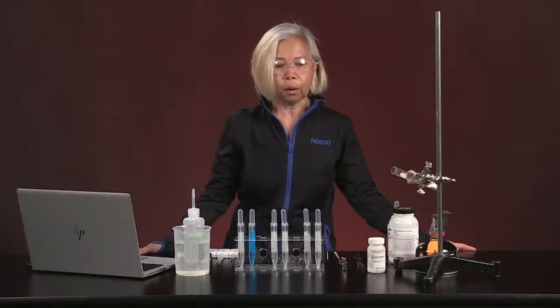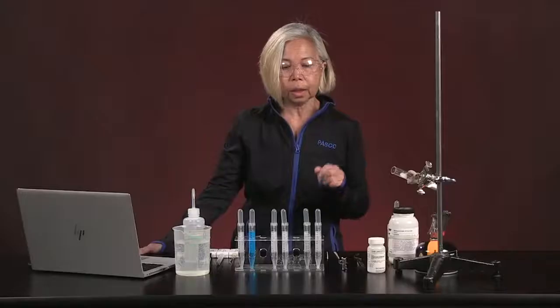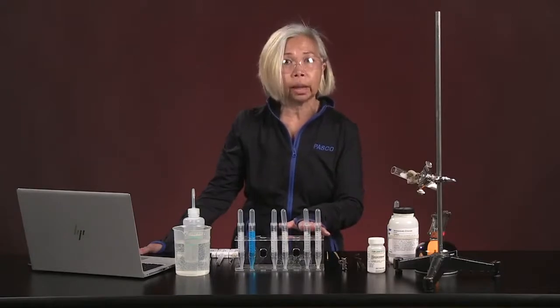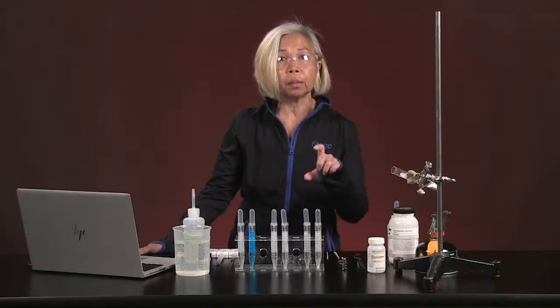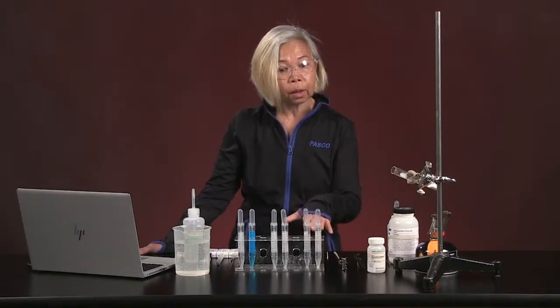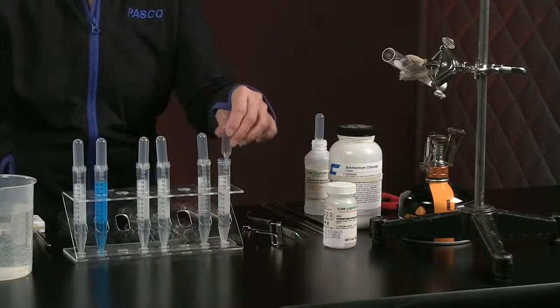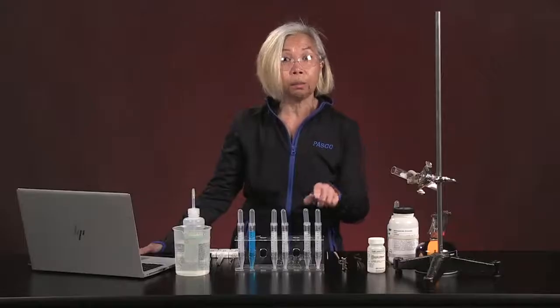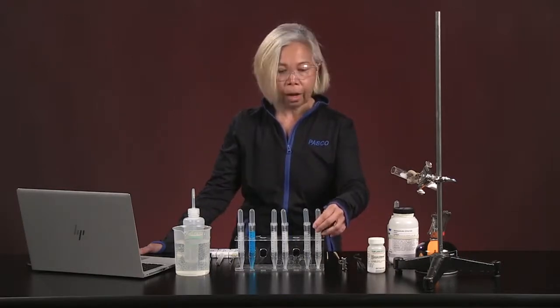To set up this experiment, we have prepared a series of 1 molar solutions, and I will tell you exactly what we have. Now, I will remind you that your lab protocol asks that each of these solutions be dispensed using a dropper bottle. We didn't have that available at the time, so I've placed those solutions in plastic test tubes, and I'm using a plastic dropper to dispense them, okay? So let me tell you what we have.